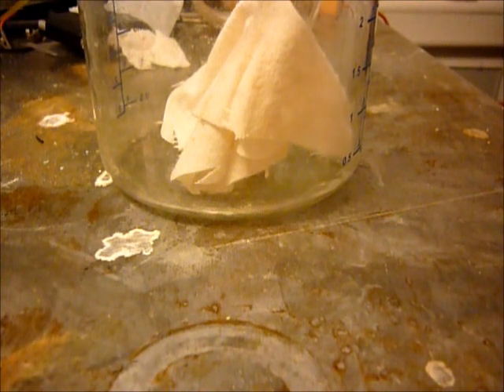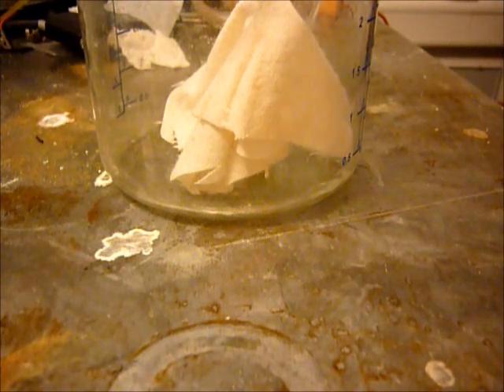Hello and welcome to a new video. Today I will show you some properties of concentrated sulfuric acid.